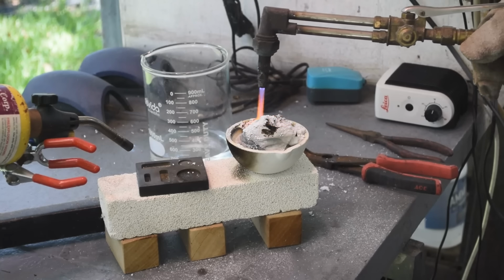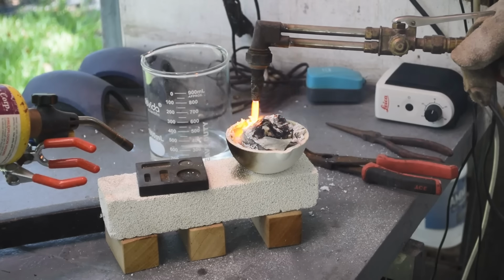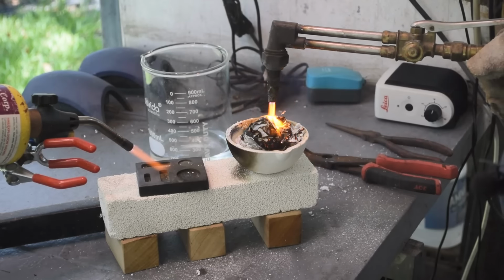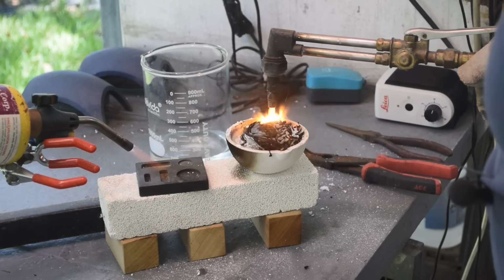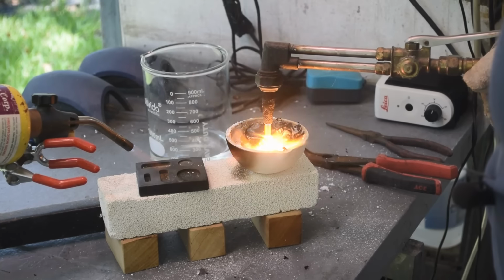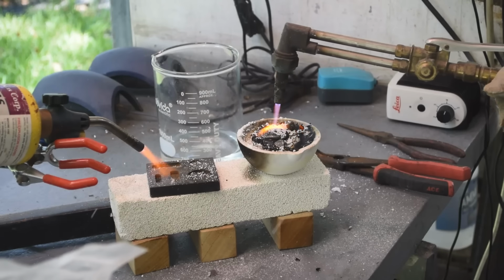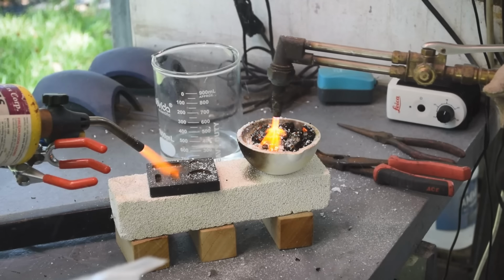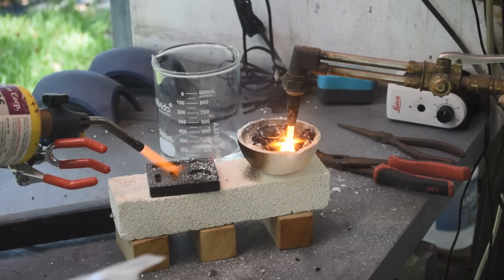Alright, I'm going to narrate this because the noise from the torches being this close to them just sort of saturates my microphone. I'm starting to burn off the filter paper here and get down to the metal that's inside it. Putting on more borax to sort of glue everything together in there. As the borax melts, it's sticky, it holds everything together. I don't want to blow any of the fine palladium powder out of the crucible. So the borax melts and glues everything together.